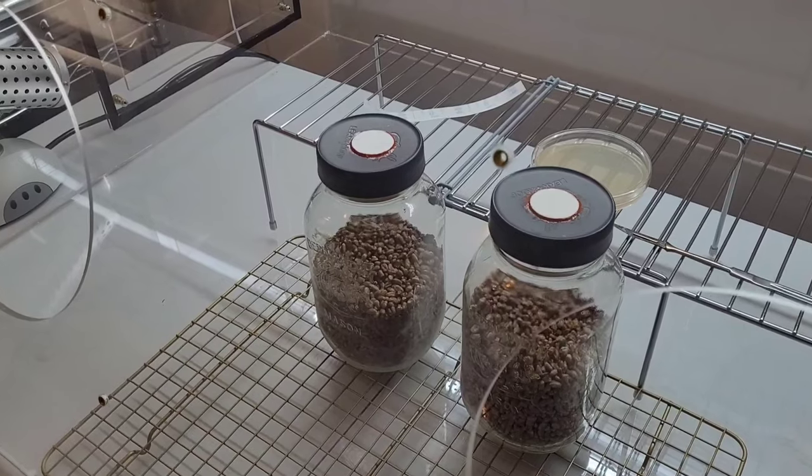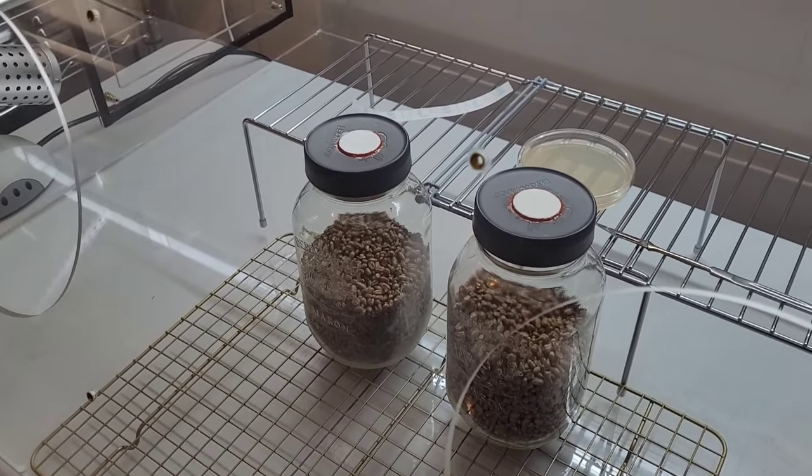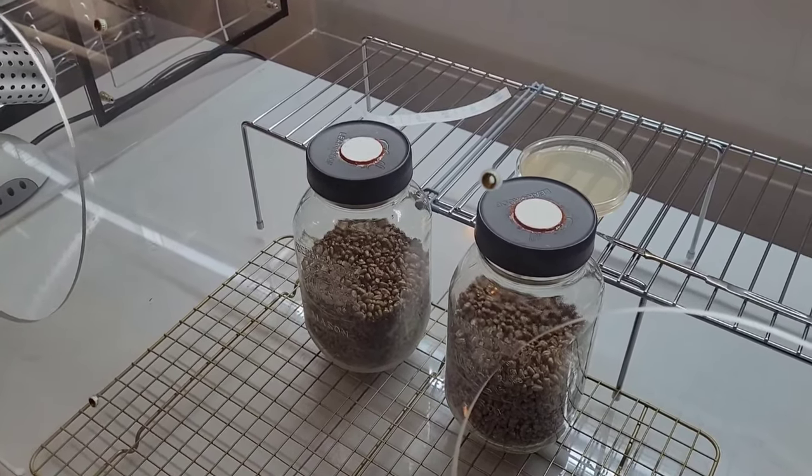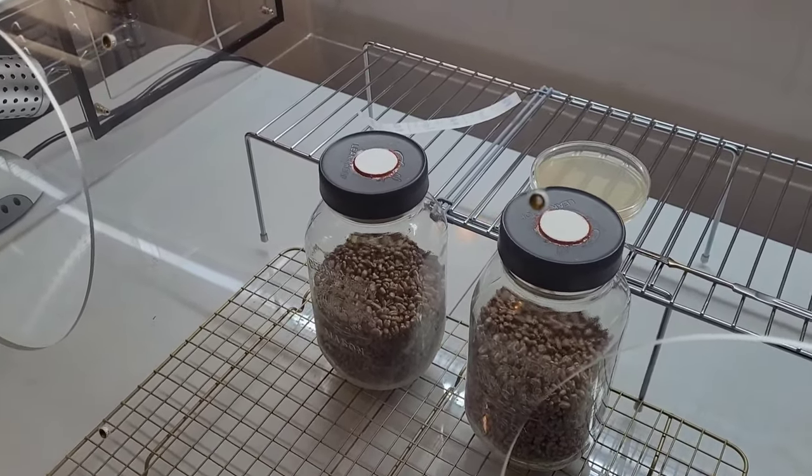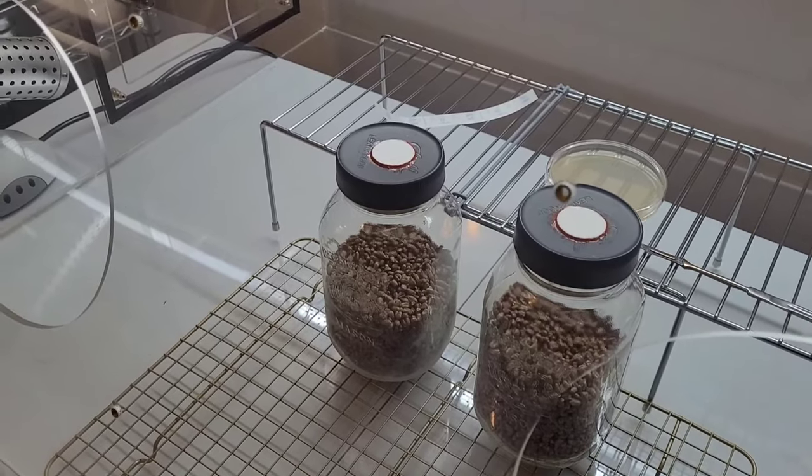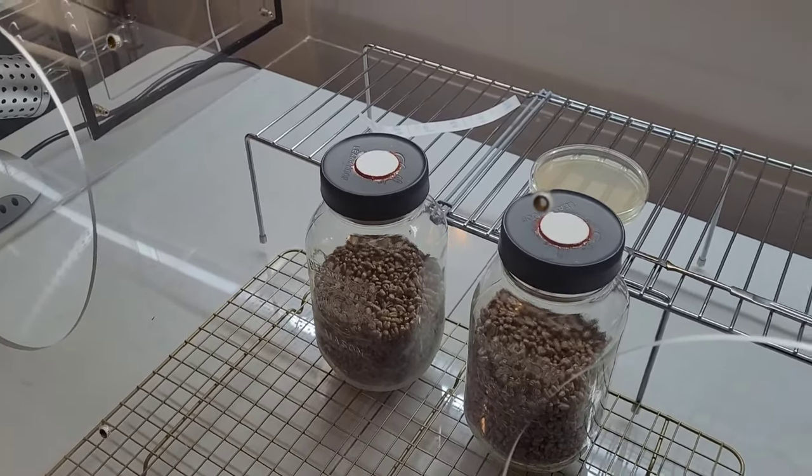Not only is it counterproductive, but it's complicated. This is as simple as it needs to be. This is as simple as it gets. There's no need to complicate. Complicated contraptions cost money and it lowers the efficiency and effectiveness of your still air box.